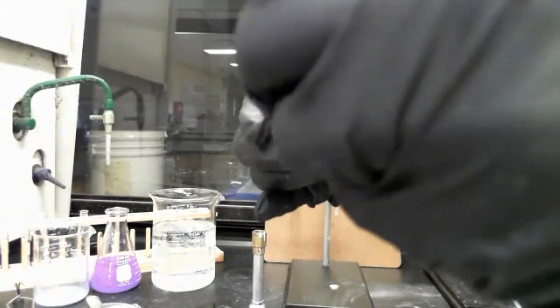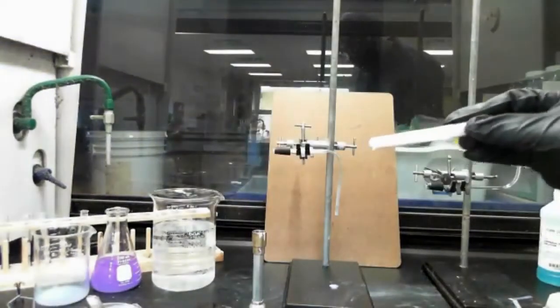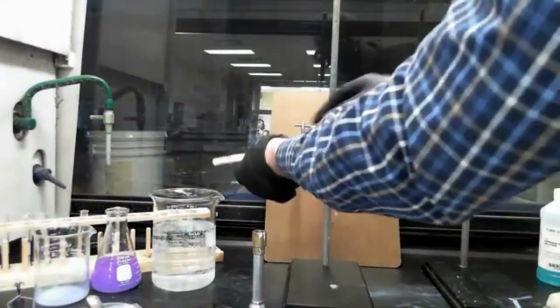All right, I'm going to do the same thing and kind of spread it out. So it's kind of spread out in that test tube. And that's going to go on here.